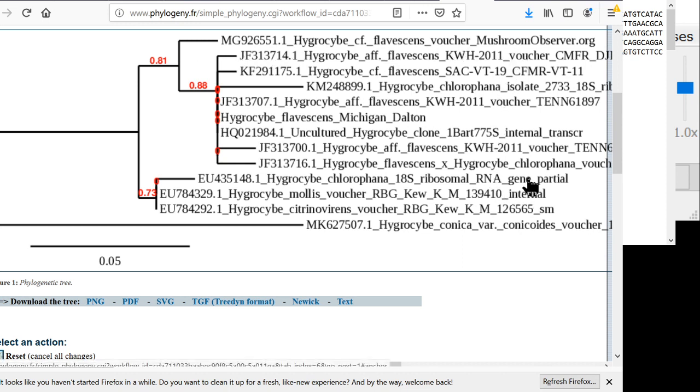Here, if I had put all of the locations, you would be able to see where else in the world my exact same species occurs. And it's all over the East Coast, Smoky Mountains, all sorts of places. And then chlorophana occurs both in North America and in Europe. And you can see that, these other species here.